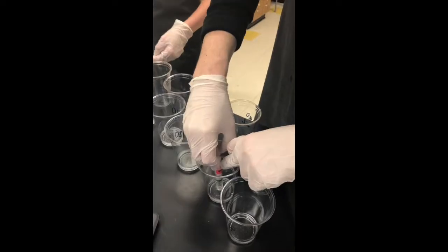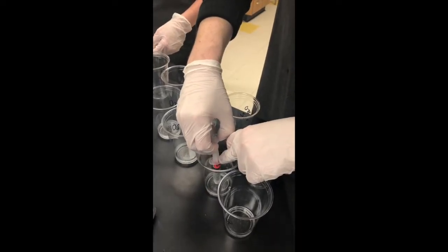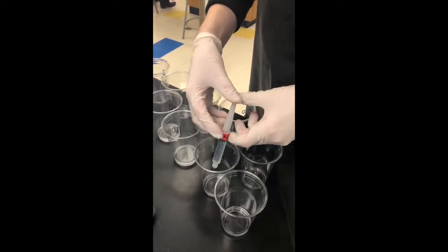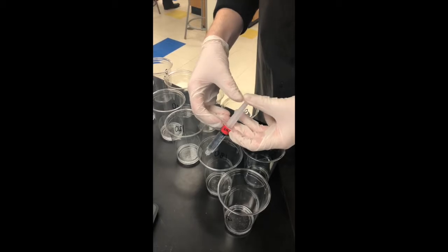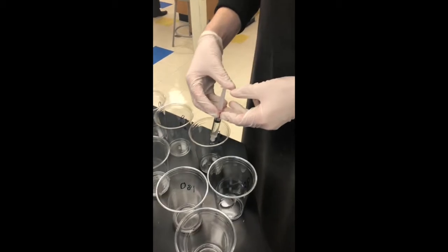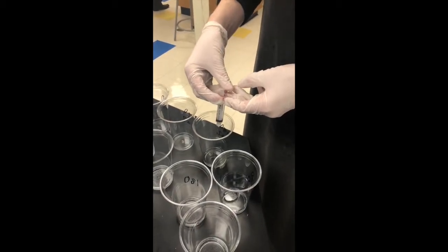Throughout this experiment, we collected data regarding how much H2O2 was broken down by the enzyme catalase over 7 different time intervals. In order to calculate this, we first needed to determine how much KMnO4 was required to titrate each sample. The method that our group chose to determine this was to count the amount of drops that it took to titrate the resulting solution of each time interval. We were able to determine that on average 23 drops equaled 1 milliliter of KMnO4, and then we used stoichiometry to convert the data collected in drops to milliliters.